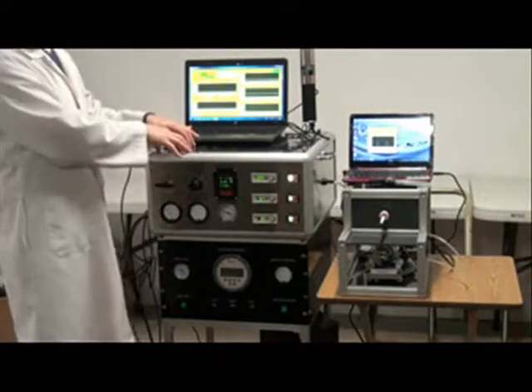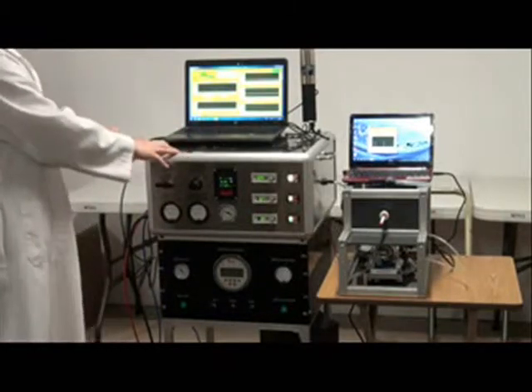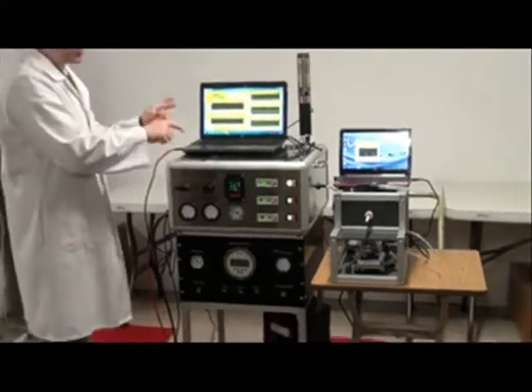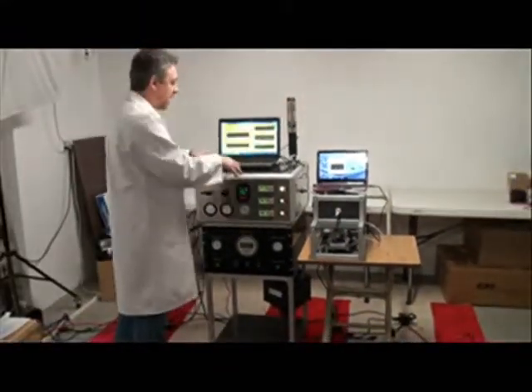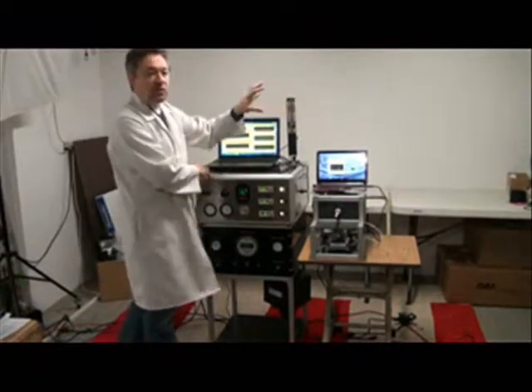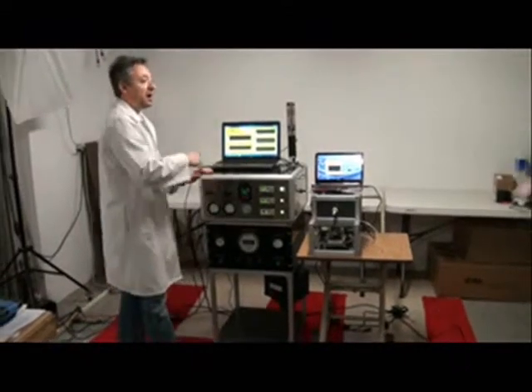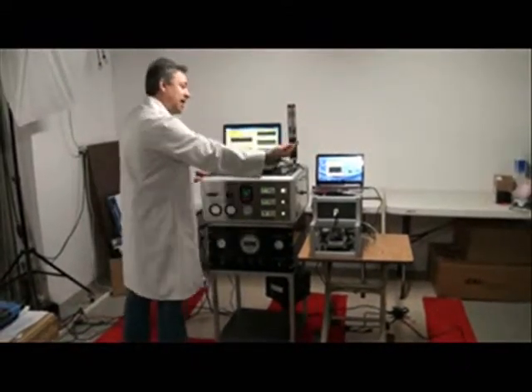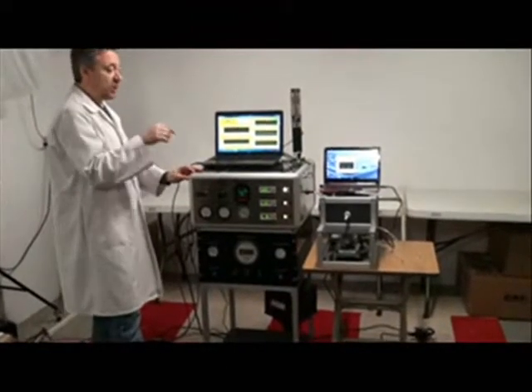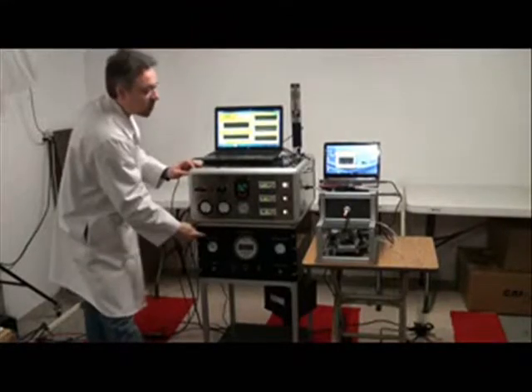Now the control of the concentration can be done inside the unit, which means that it controls the concentration at the outlet of the siphon, or it can be done remotely by removing the aerosol monitor from here and connecting it to the inhalation tower or exposure chamber in a remote location, and then sending the signal back. In that latter case, what we are actually controlling is the concentration of the mixed smoke.